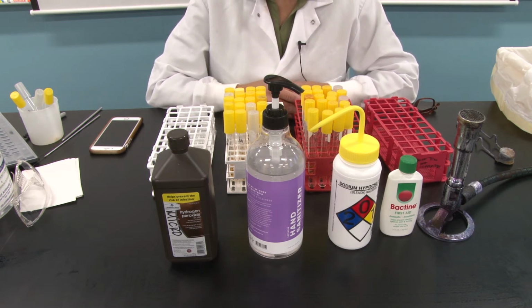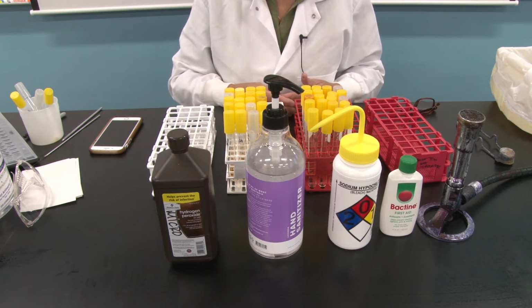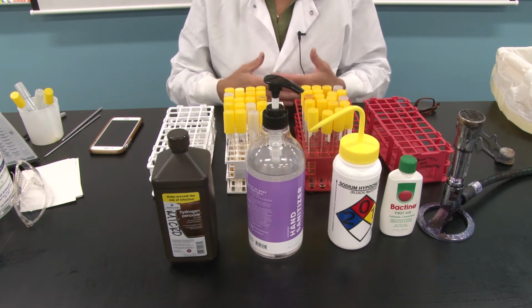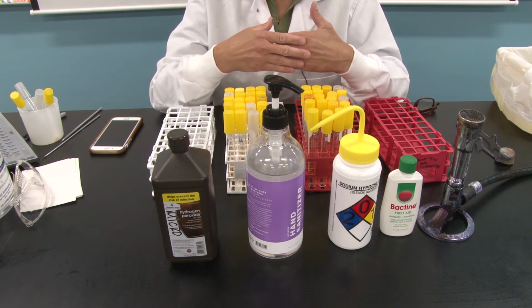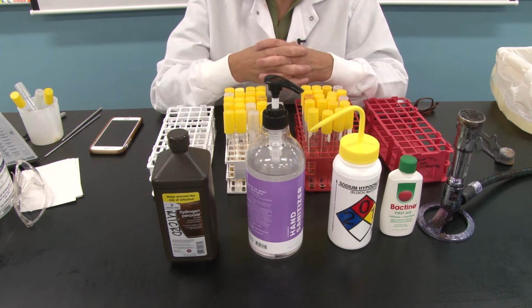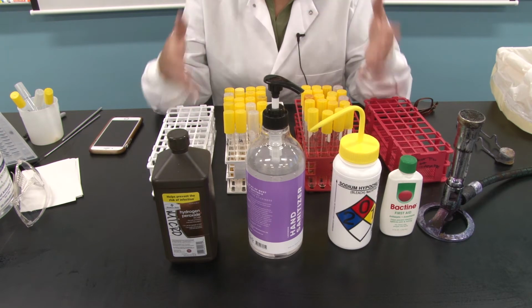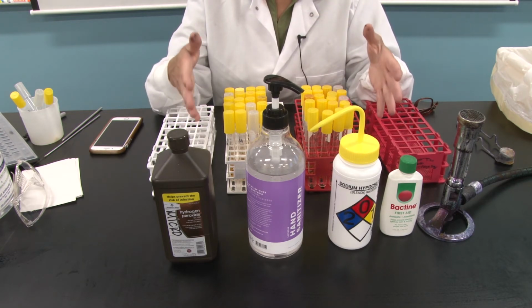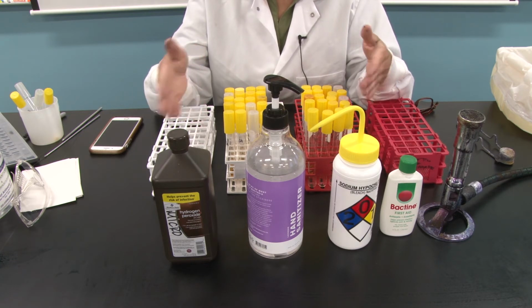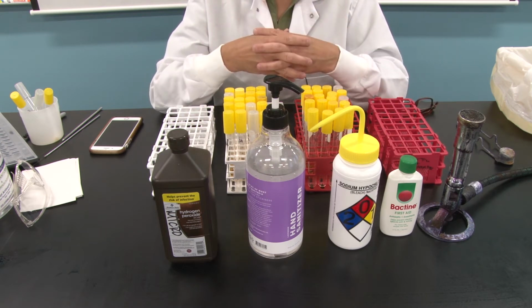That means we're removing pathogenic microorganisms, and those are usually bacteria and viruses, not necessarily all microorganisms. In fact, we know many disinfectants and antiseptics remove pathogens with the exception of bacterial spores, and some spore formers are pathogenic. So when we look at the 4 products we have out in front of us, their purpose is disinfection. The question is, are they a disinfectant or are they an antiseptic? So here I want to clarify the difference.